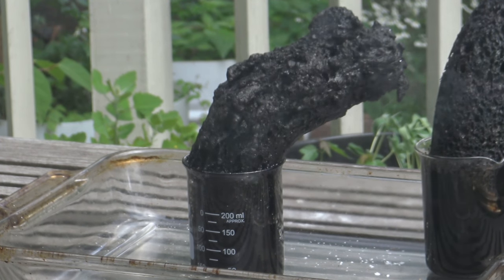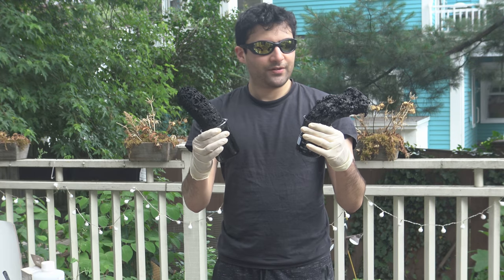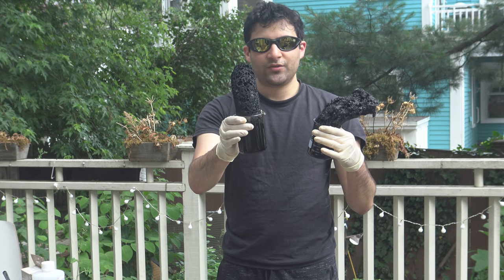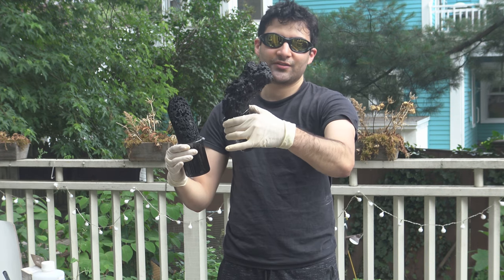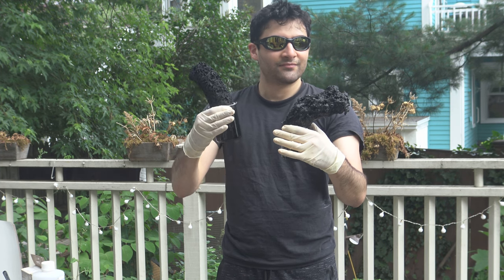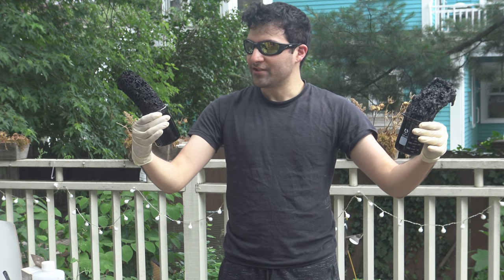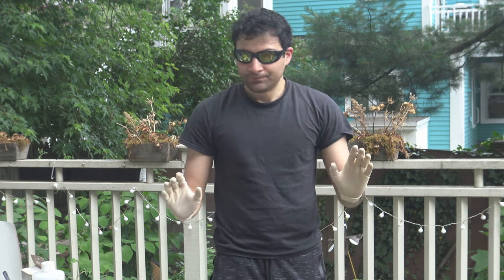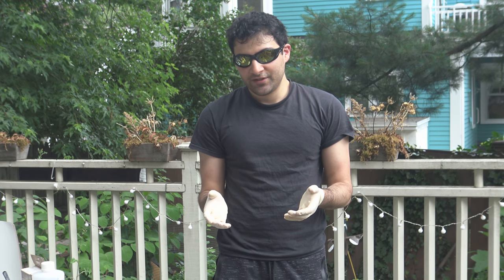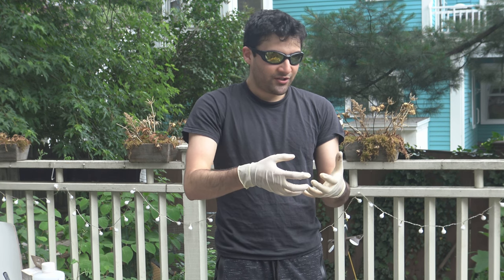You can see a very easy and quick difference between the two. If you look really closely, this one's a lot more solid — you still see the holes lining it, but the structure looks a lot more uniform. Whereas this one, it's all over the place. You can see the sugar actually solidifying as it got reacted into place almost. Both of these are pure carbon. I still have to neutralize them a little bit. The beakers are still warm. You took something that was a mixture of carbon, hydrogen, and oxygen and just made it pure carbon using a dehydration reaction. The sulfuric acid actually yanks the water out of the sugar and makes pure carbon.